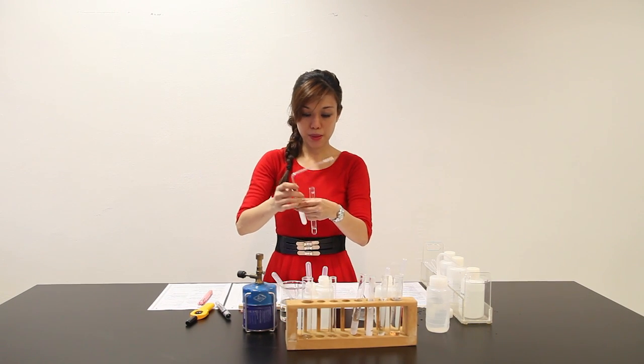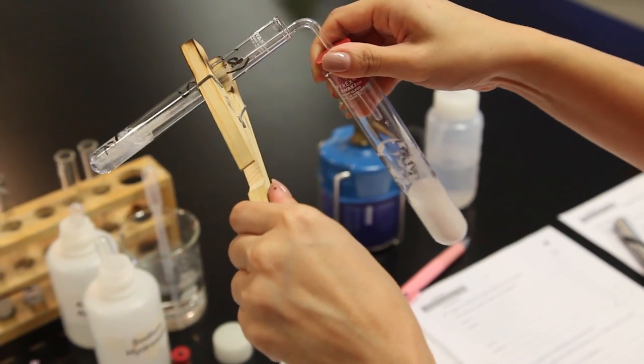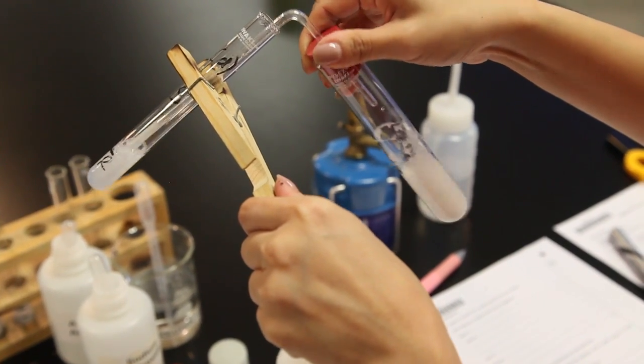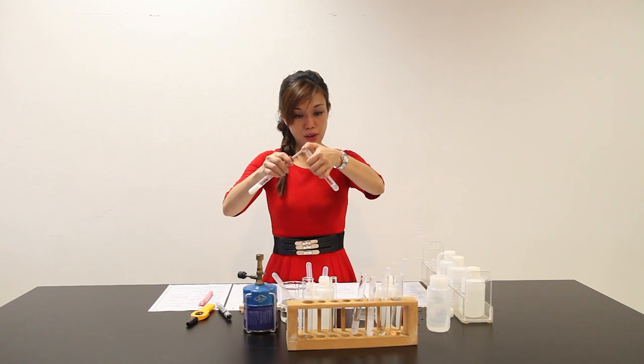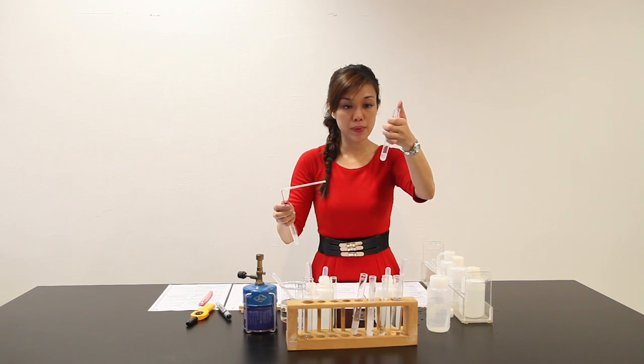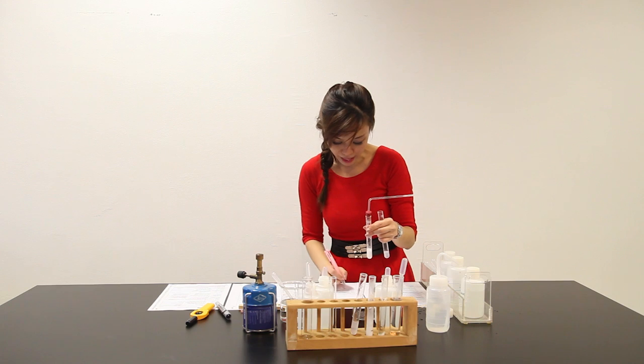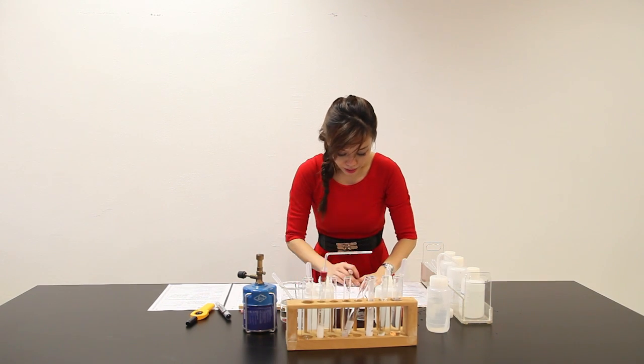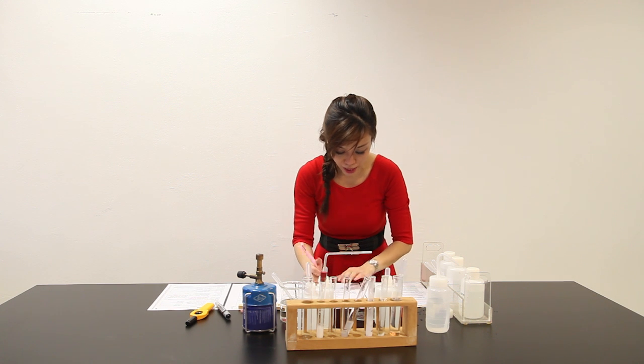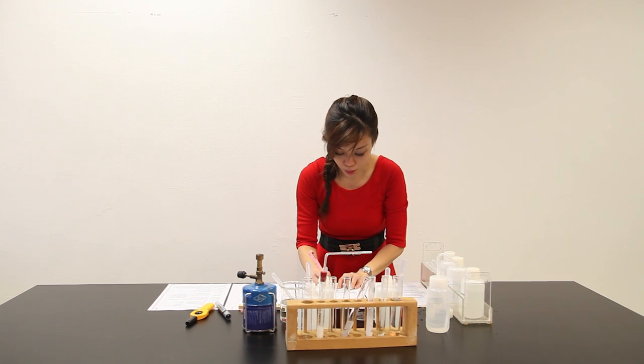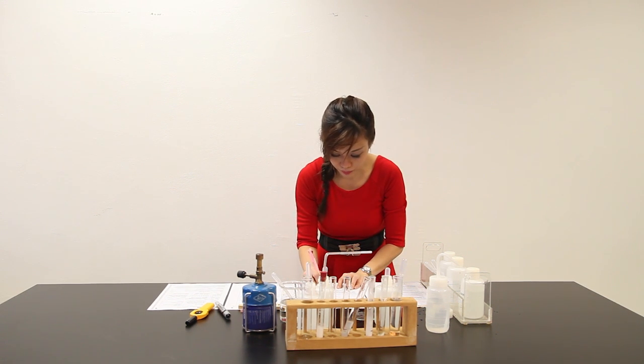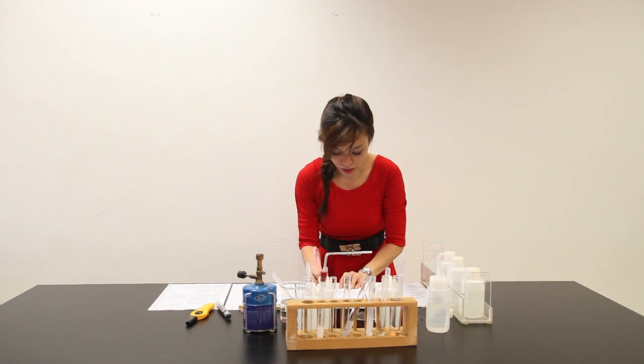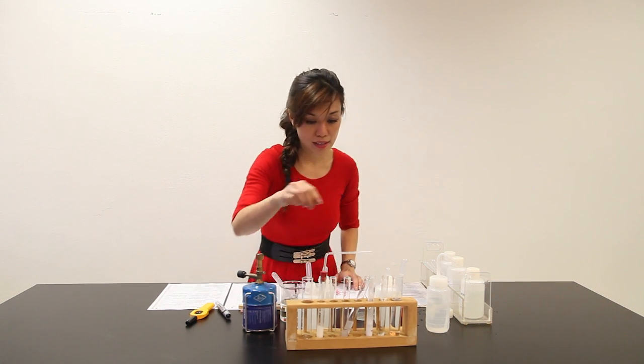Bubbles are observed. Let me bubble through solution R. Very quickly, white PPT is observed. Let me write down: I can safely say that white PPT is observed in solution R. Let's go on.